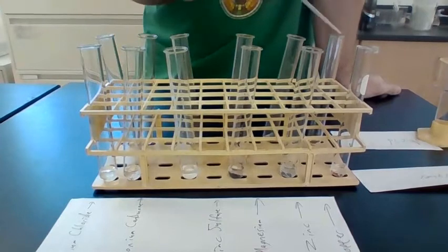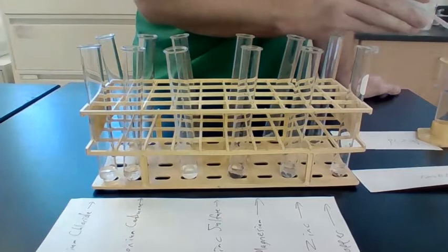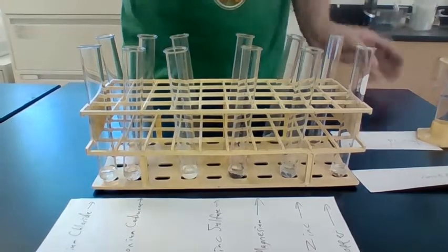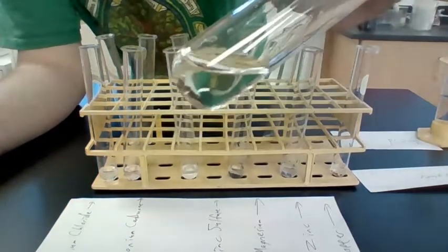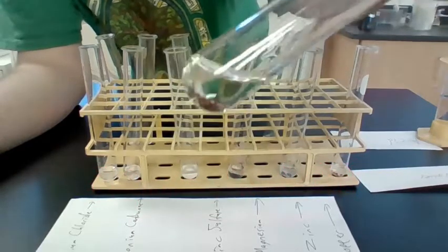So the reason we have 2 test tubes of each chemical is because we're testing one of them with water and the other one with acid. So now we're going to test these all with acid. Doesn't look like it's doing anything to me.